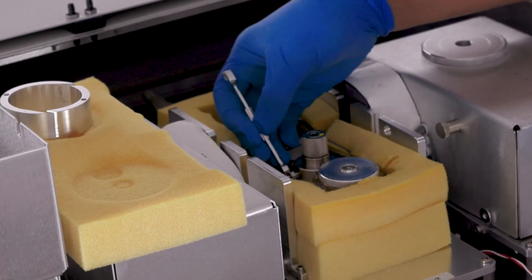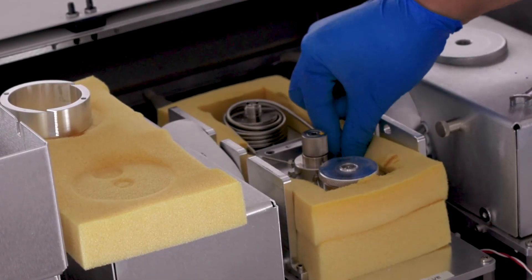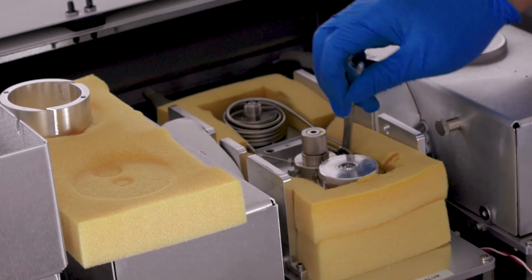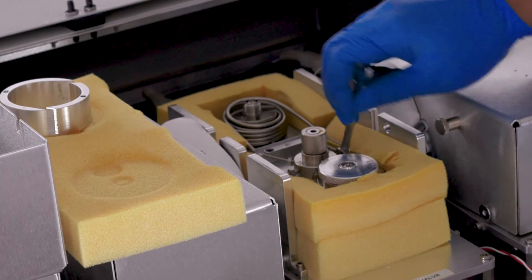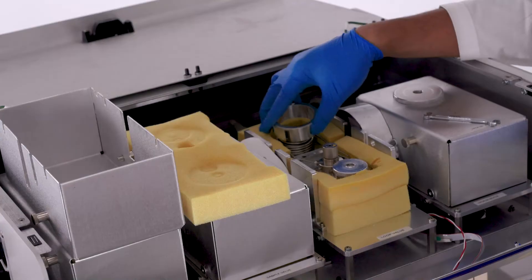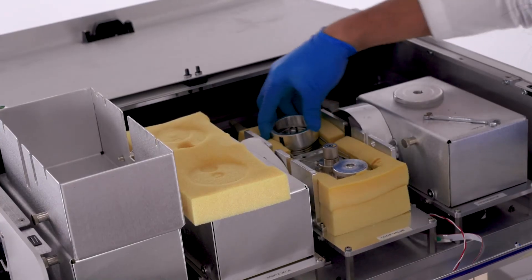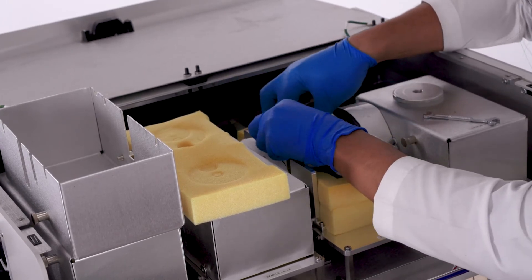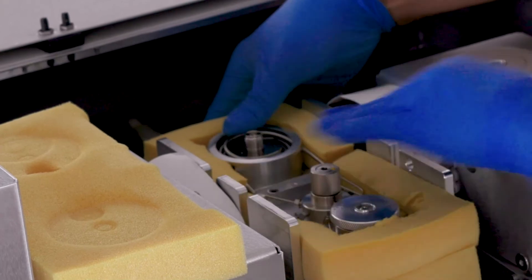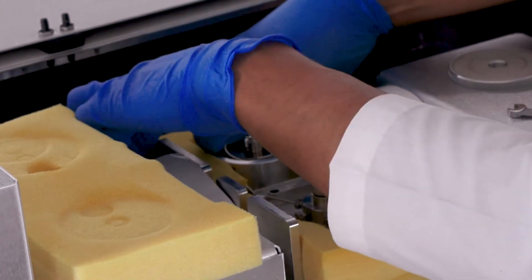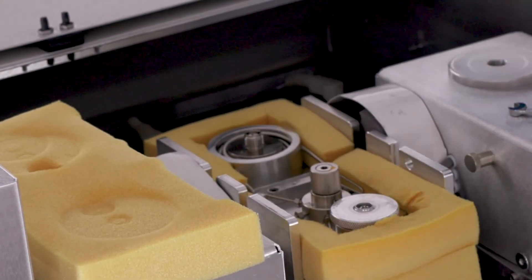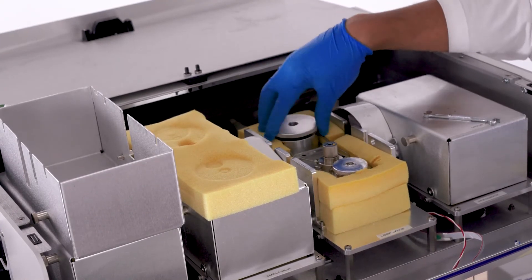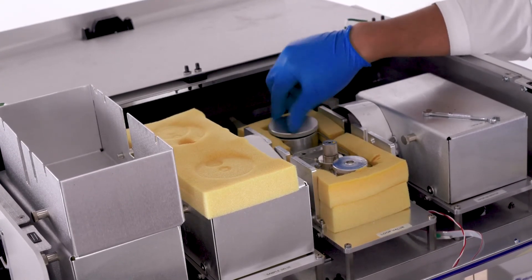Use a quarter inch wrench and securely tighten the loop nuts. Place the enclosure ring firmly into place. Screw on the top nut until finger tight and tighten the middle screw if it was loosened previously.